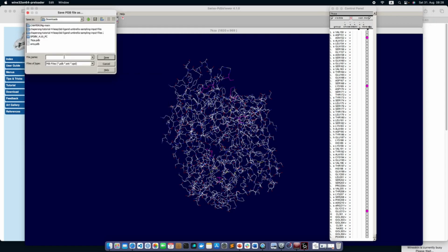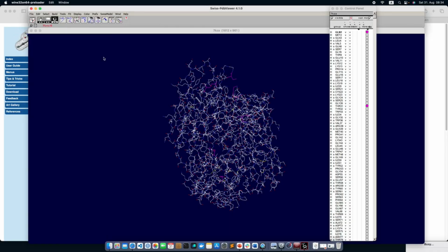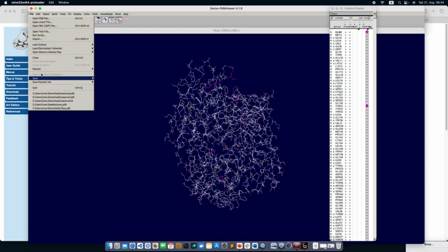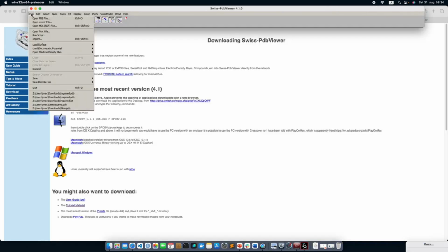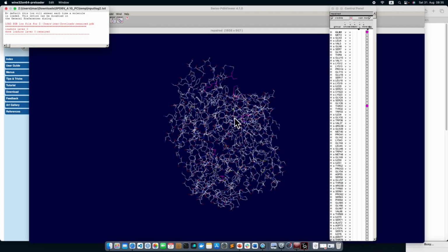And that's it. Once it is repaired, you can go to File, Save, Current Layer, and then save it as repaired.pdb. Okay, save it, and now you close it. If you try to open the PDB file again, you can see the repaired.pdb file, and the prompts will disappear because it has already added all the missing atoms in your protein. And that's it. You are ready for AutoDock Vina.